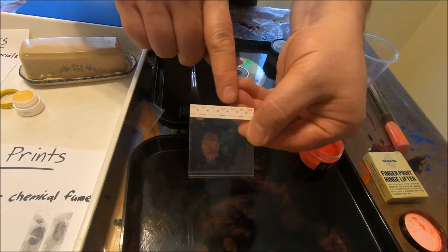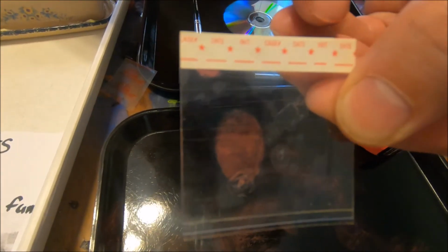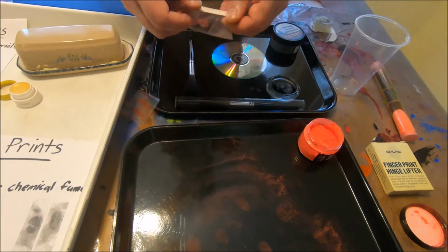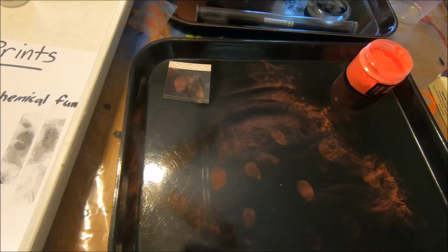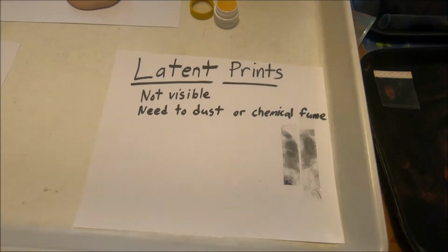and pull that print. And now we can see not only is the print secured in there, but our chain of custody information around the top. It's got the date, the inventory, the case number. That information would be all part of our chain of custody and allowing us to use it later on at a later date in a court of law. So as we're working there, using a contrasting color to whatever you're working with dusting wise is going to be key.